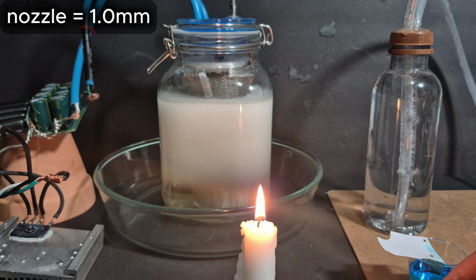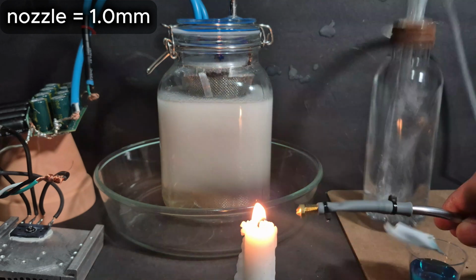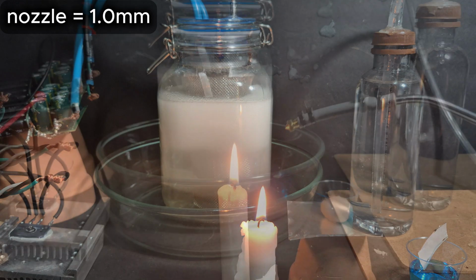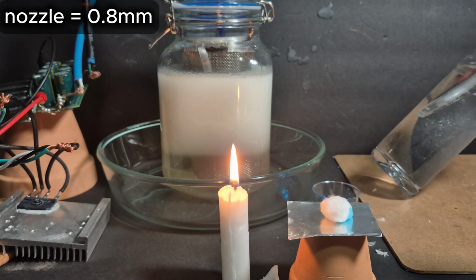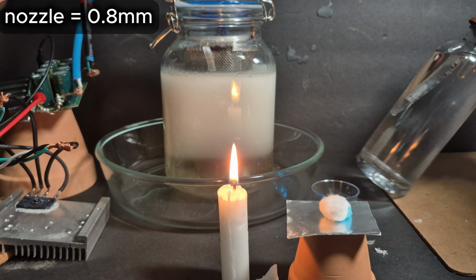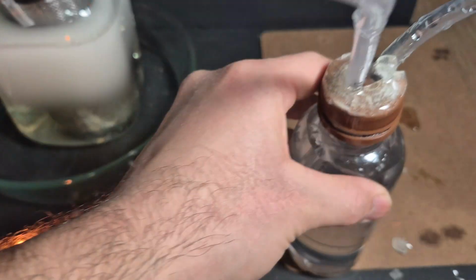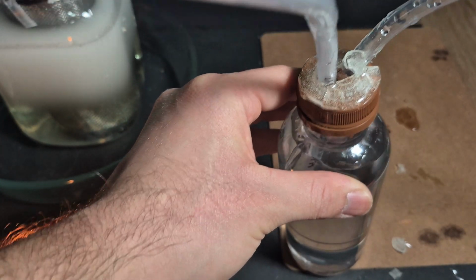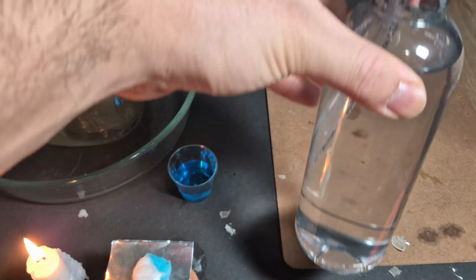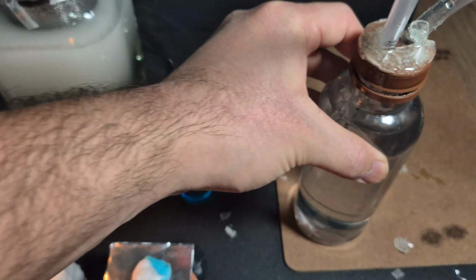Now it's fun time. Even with the 0.8 millimeter nozzle, the same thing happened. It's just ripped open the epoxy and everything.